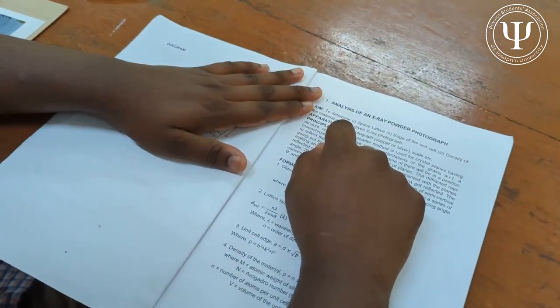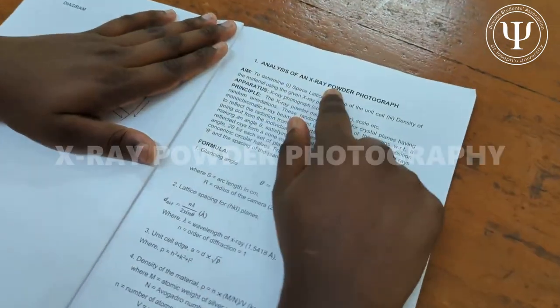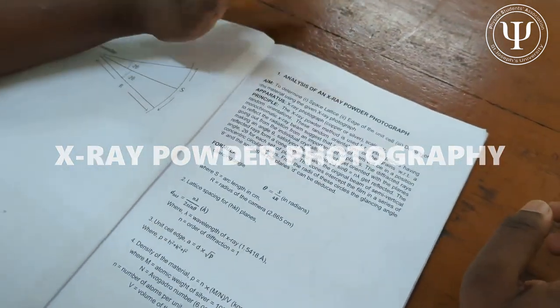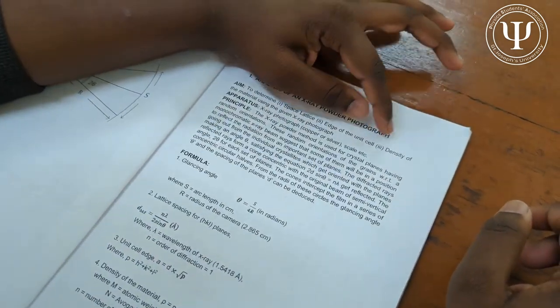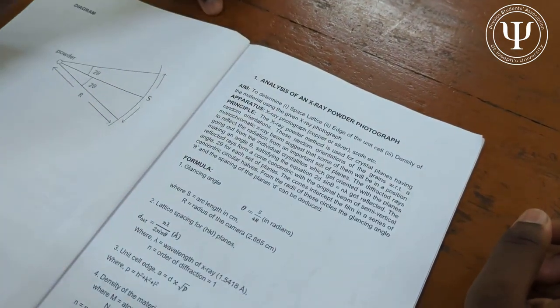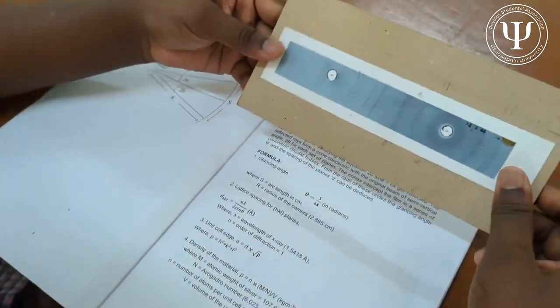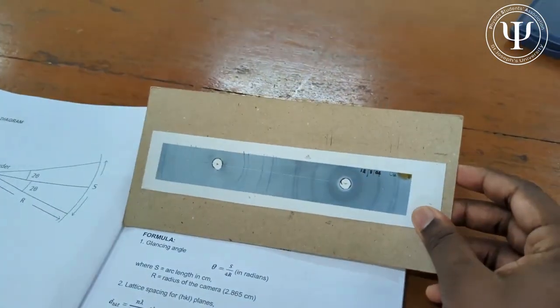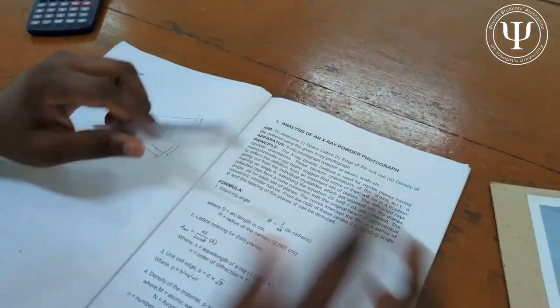Today we are going to learn about analysis of an x-ray powder photograph. The main aim of the experiment is to determine the space lattice, the edge length of the unit cell, and the density of the given material using x-ray photographs. Basically we just need two things: the x-ray photograph and a scale to measure the length.